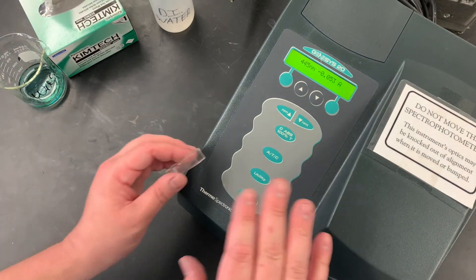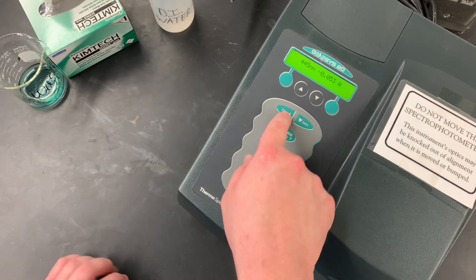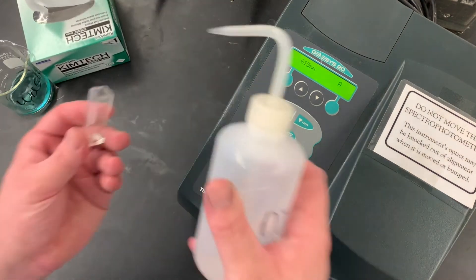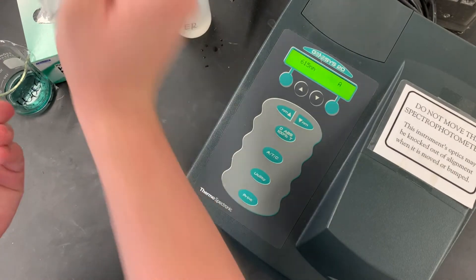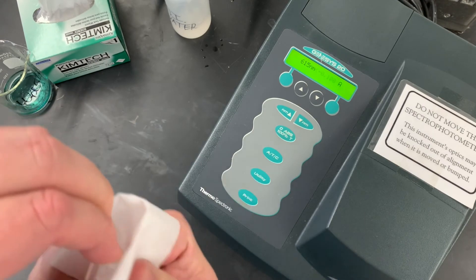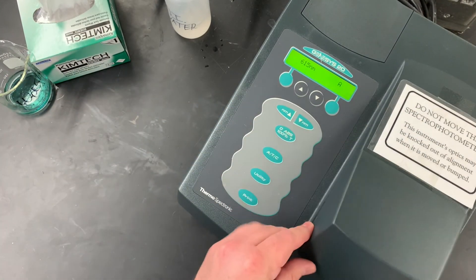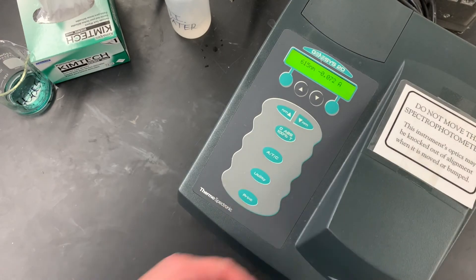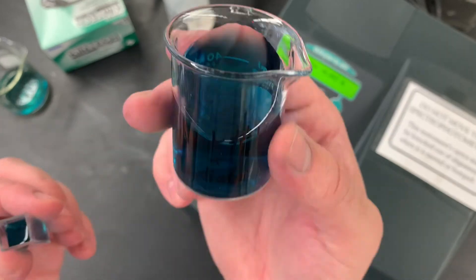Now that we have finished all of these, we can go ahead and crank this up all the way to 615. Once again, some DI water — fill it up — this is the blank for the second wavelength. And now, once again, we're going to go through all of the solutions — testing, rinsing the cuvette, drying the cuvette, filling back up, repeat, until you've gone through all the solutions.